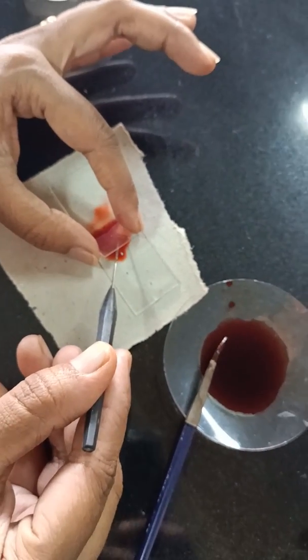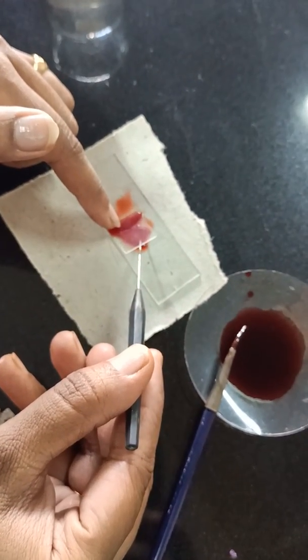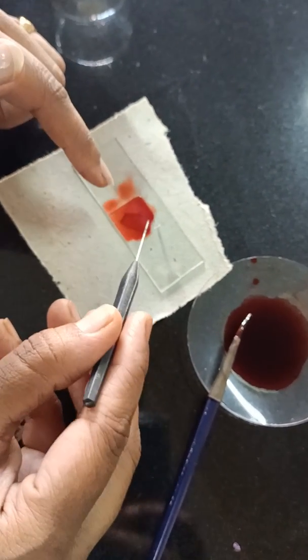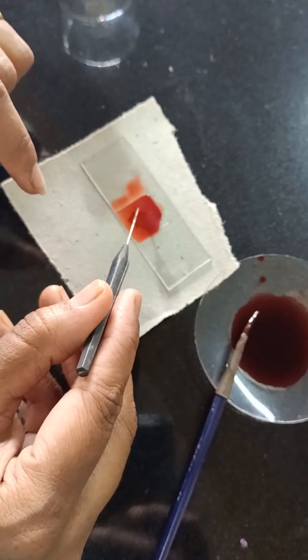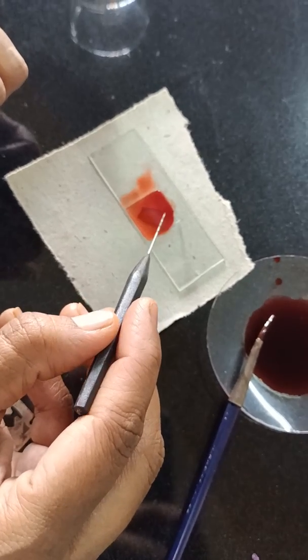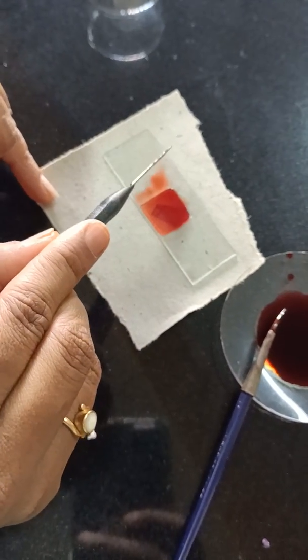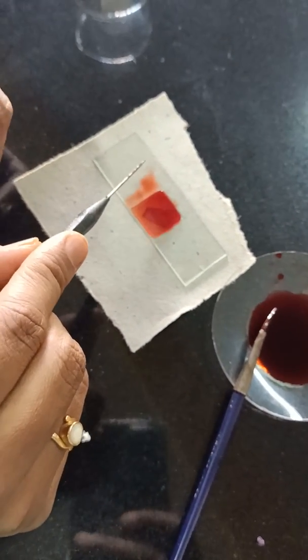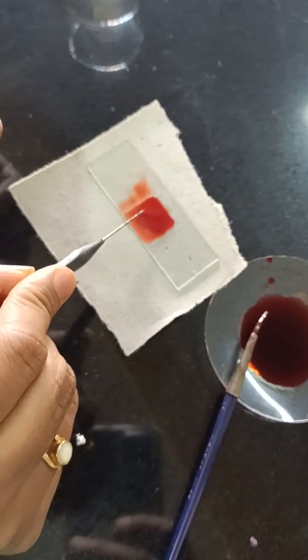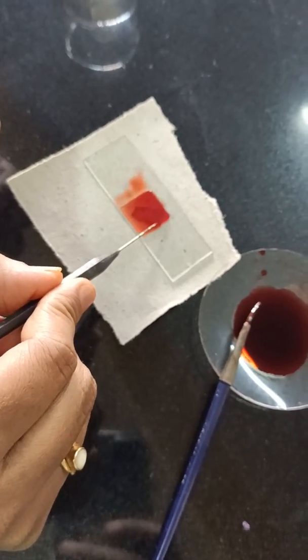Now putting the coverslip for the onion peel for nuclear staining. For this question you need to write the shape of the cell — that is rectangular in shape — and the number of nucleus per cell, which is one, peripheral in position. Report the shape of the cell as rectangular and the number of nucleus as one per cell. For slide preparation 3 marks, and for reporting another 2 marks — total 5 marks.